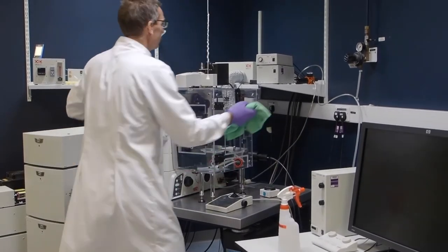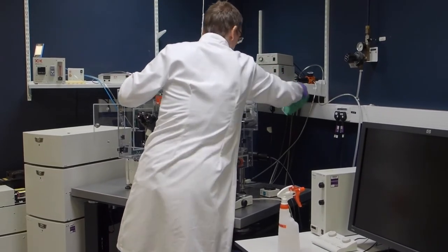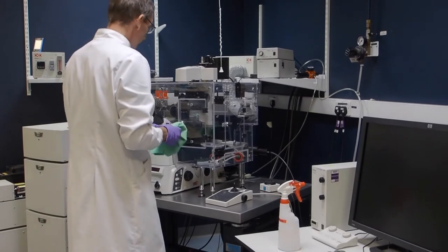Finally, clean the peripheral control boxes and make sure all the switches on the microscope stand are cleaned, including the laser key.